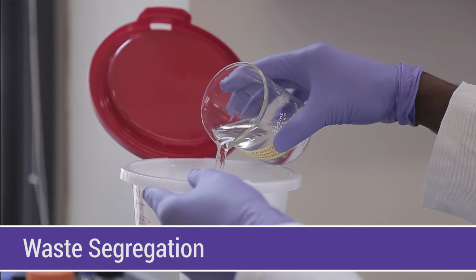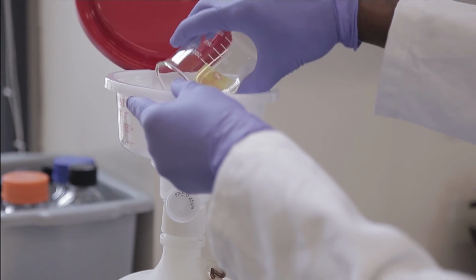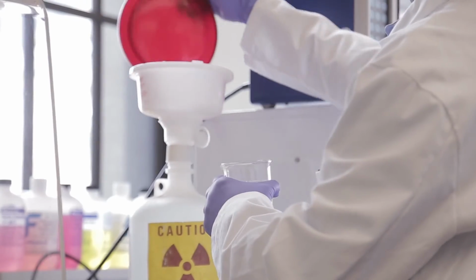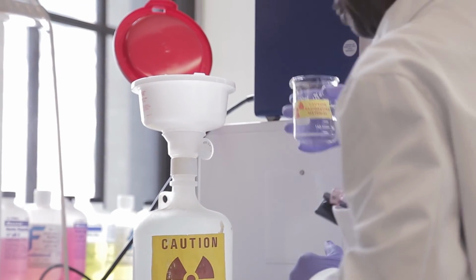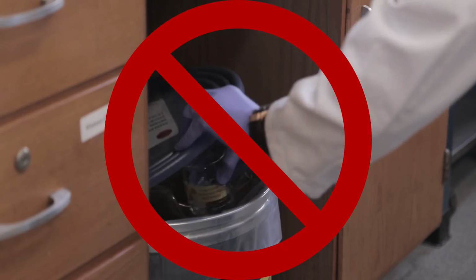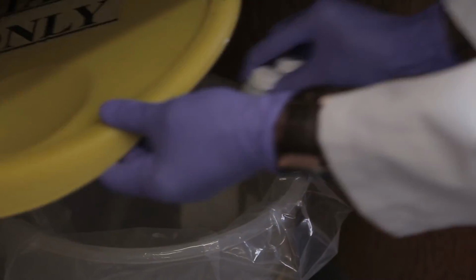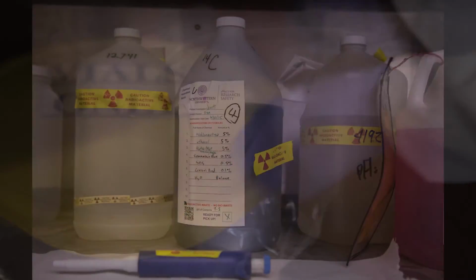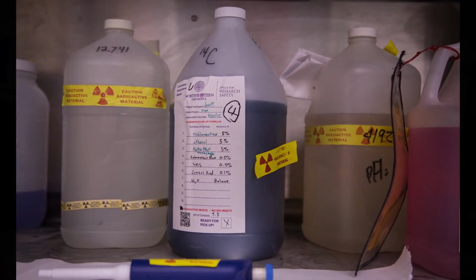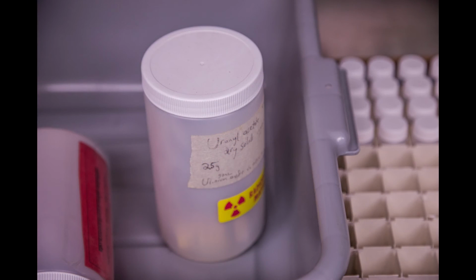Waste must be segregated into the appropriate waste stream. If you are using more than one radionuclide, mixing them in waste containers is not allowed without ORS HPS permission. Dry waste and aqueous waste may not be mixed. Vials containing liquid scintillation cocktail should be disposed in a 5-gallon plastic bucket. Mixed waste may be dry or aqueous and should be disposed in the corresponding waste container following waste minimization efforts.